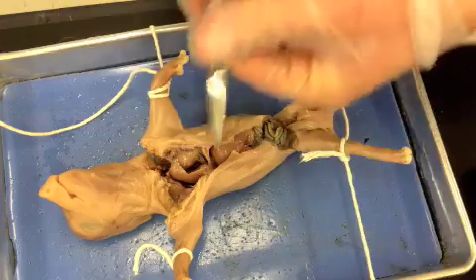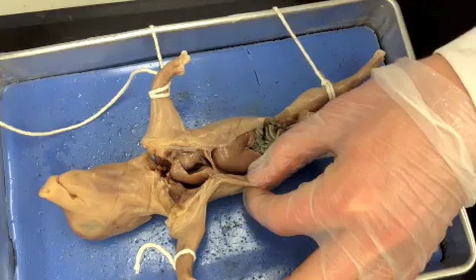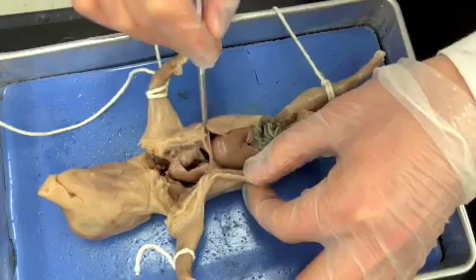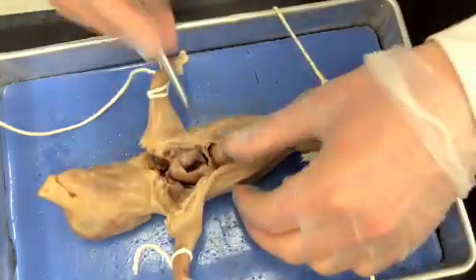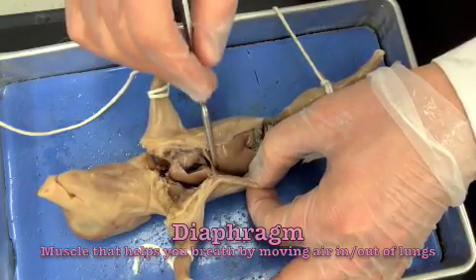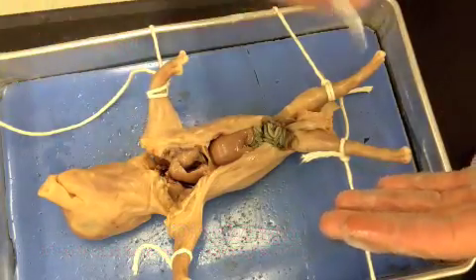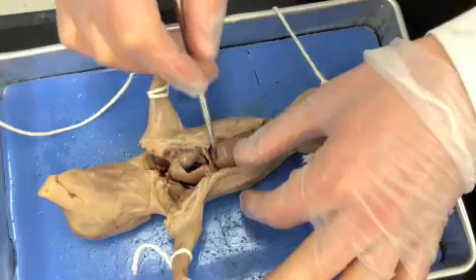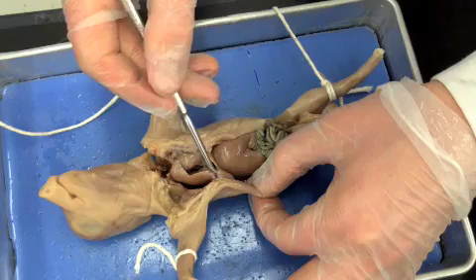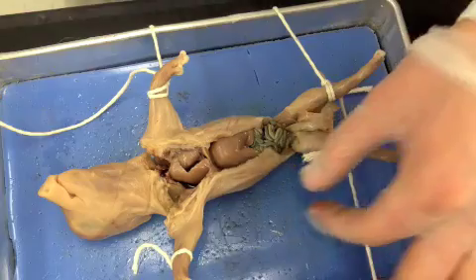The reason I don't cut these sides yet is because there's a flap here that I'm going to have to cut through in order to fully open this up. This flap is a muscle called the diaphragm — it aids in the process of breathing. As it contracts and relaxes, it helps with the opening and closing of your lungs. I wait until the end so that you can see the diaphragm, and then I cut through the sides and through the diaphragm.